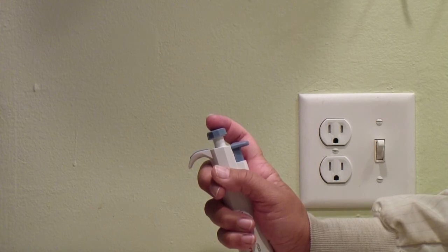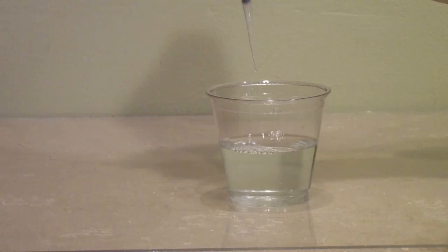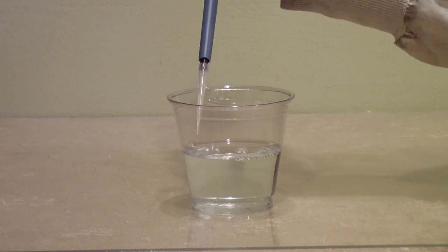When you deposit the liquid, you push the plunger down to the first stop, which pushes most of the liquid out of the tip. However, sometimes there may be just a little drop of liquid left in the tip. Pushing down to the second stop ensures that all the liquid is expelled.